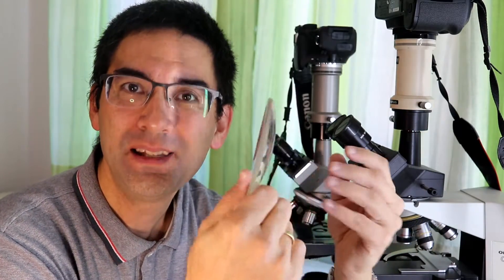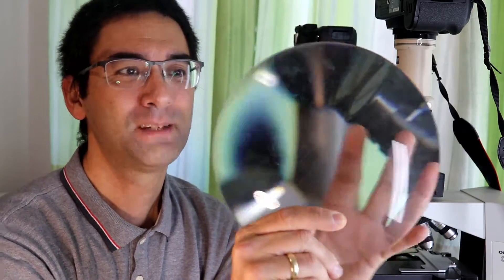Let's start with a few misconceptions. For example, I have a convex lens here — what magnification does it have? To be very honest, lenses like this are not really defined by their magnification. You might say that's not true because there is a magnification written on the objective of a microscope, but actually this means something different, because the magnification of a lens or objective strictly speaking depends on the distance.